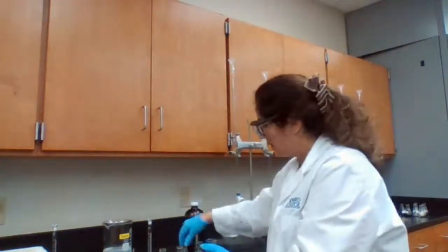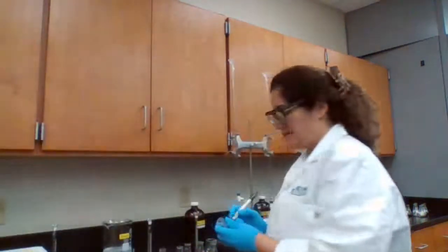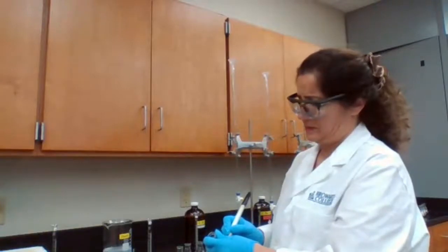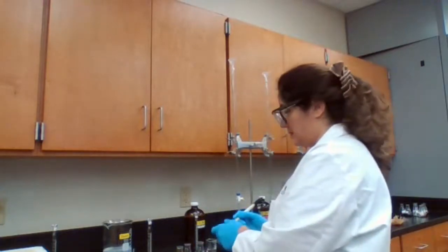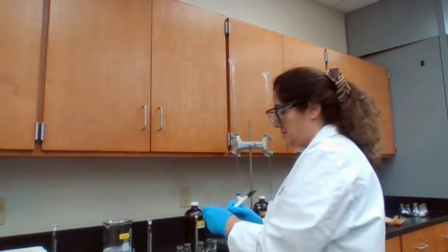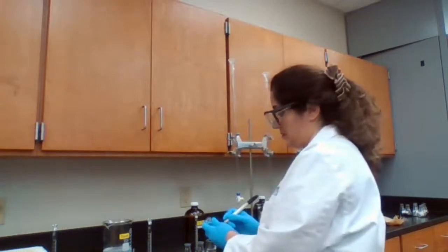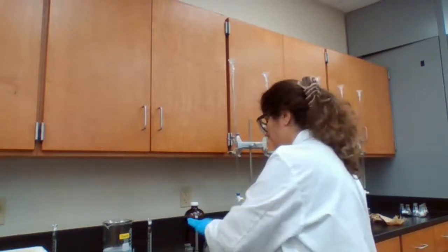Going to prepare labels. I have A5, A6, A7. We have B7, B6, and B5.